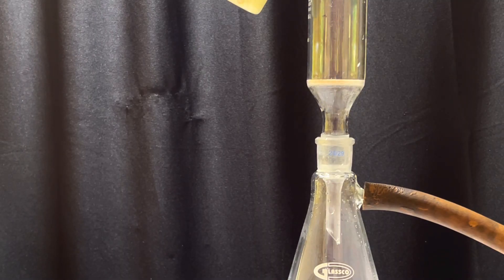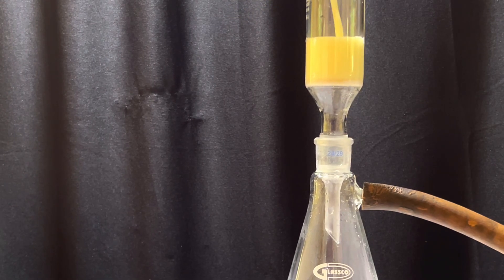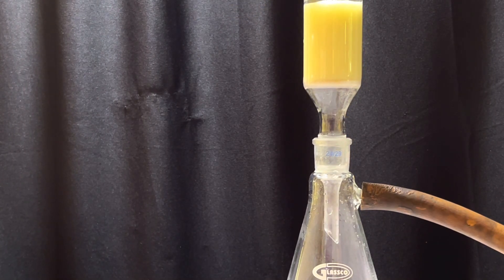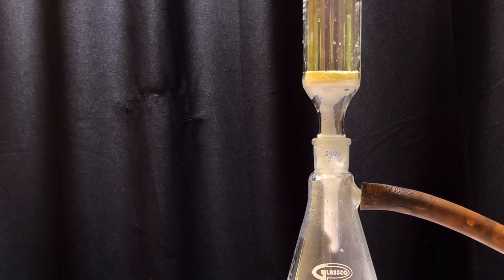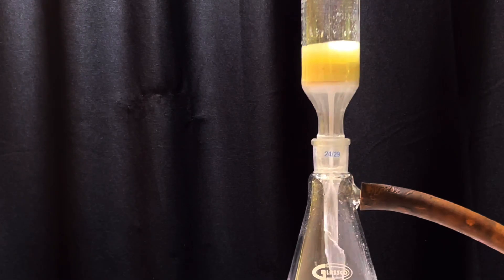Crude product was then collected by vacuum filtration. The product was washed a couple of times with ice-cold water in the filter funnel itself.